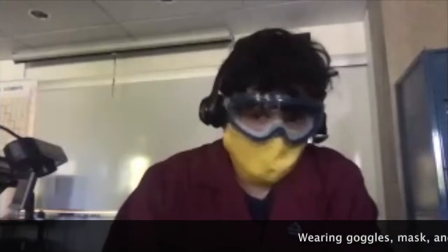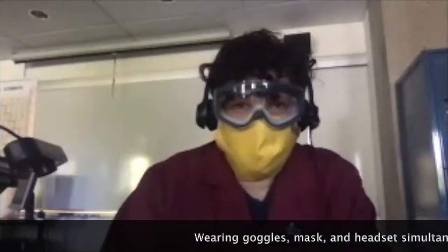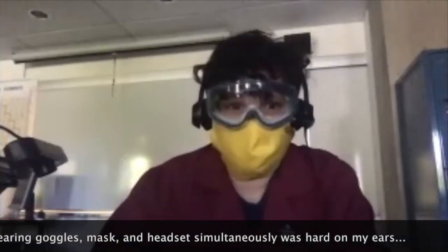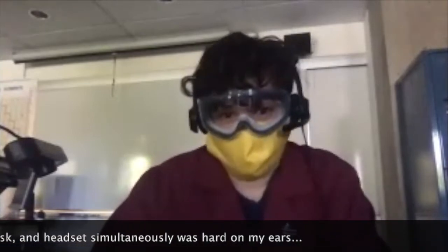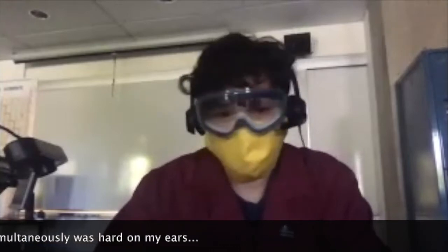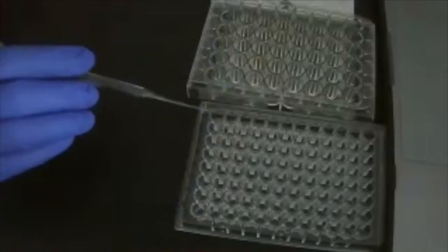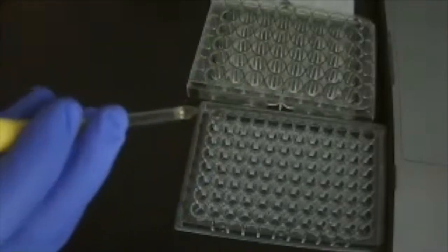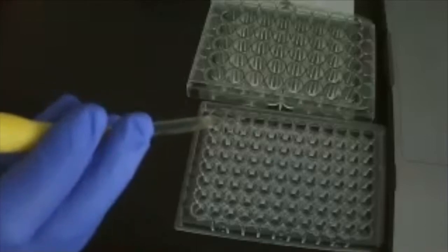We've got 6 different reagents, and what I'm going to do is I'm going to test all the possible combinations of 2 in those 6 different reagents, which, by the way, is a lot. So you all have the list, and pick one. Let's pick one. In the first few cells, I'm gonna do 2 drops of luminol in each cell, and then I'm gonna drop 2 drops of whatever.